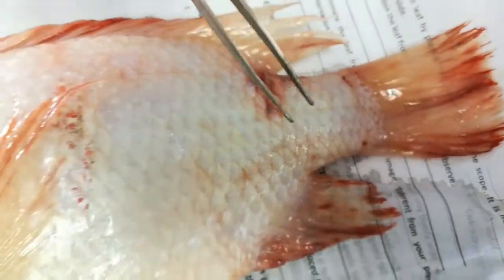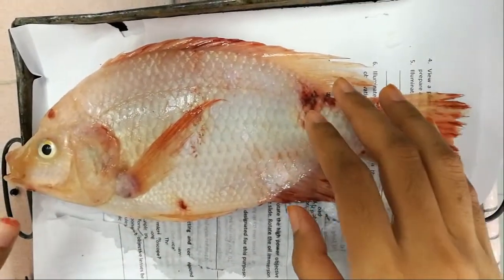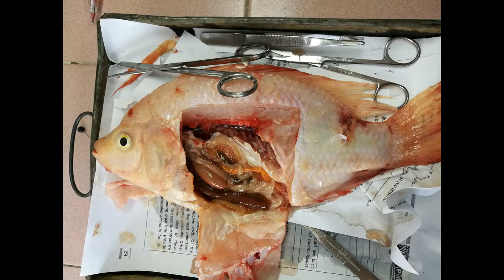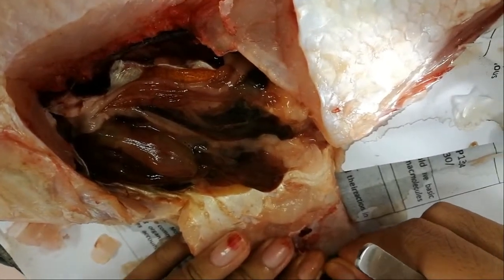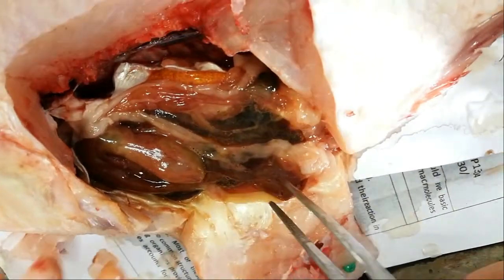Let us proceed with the internal anatomy of the fish. This is how it looks after the dissection — after we cut open the abdomen of the fish. We are going to pin it first so that it won't move, and then continue with identification of the internal anatomy.